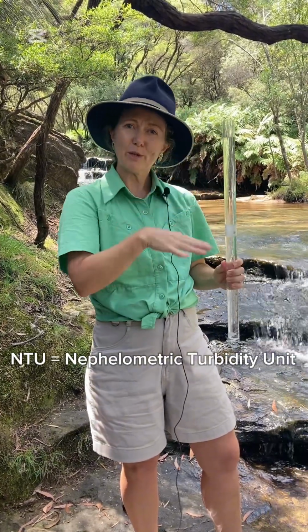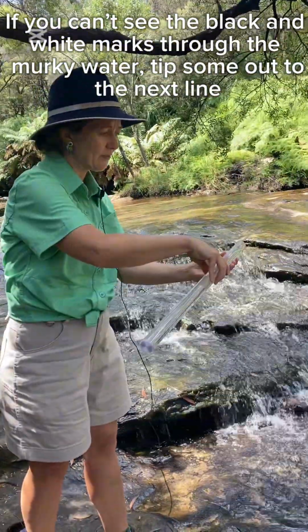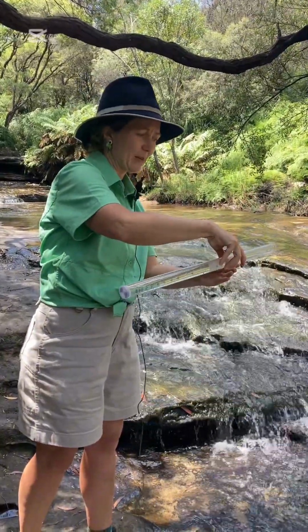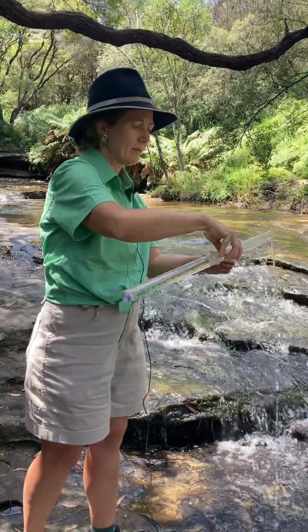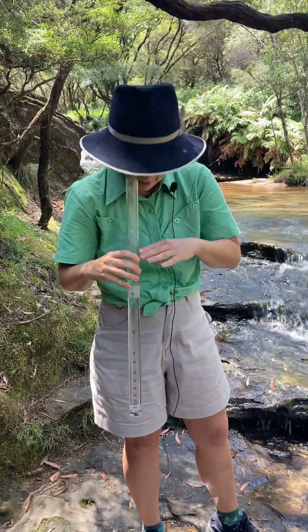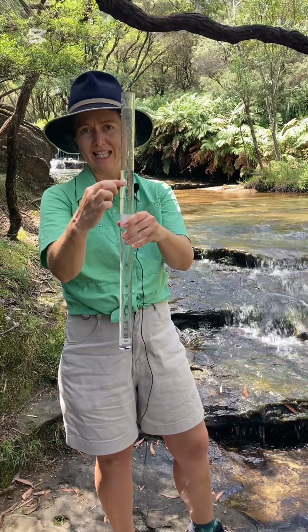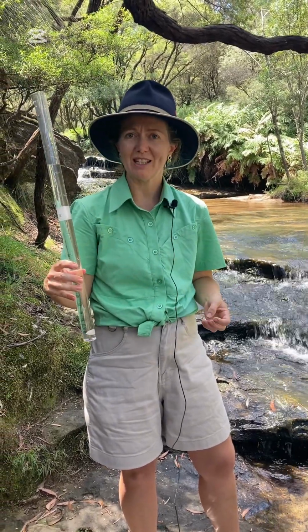But if it was murky water, what I would need to do would be to tip it out to the next level, hopefully as accurately as possible. And then have another look through. And if at that point I could then see that marking on the bottom, the result would be 15 NTU. And that's how we test for turbidity in a creek.